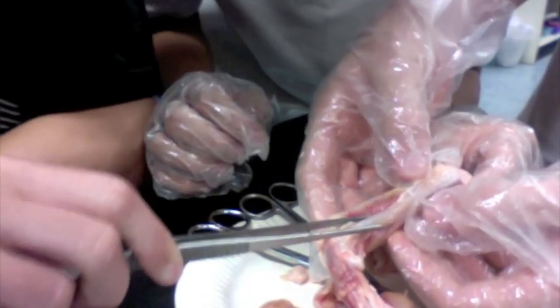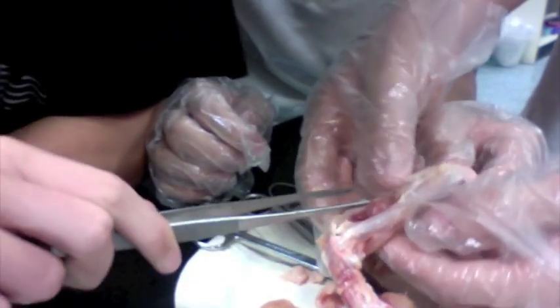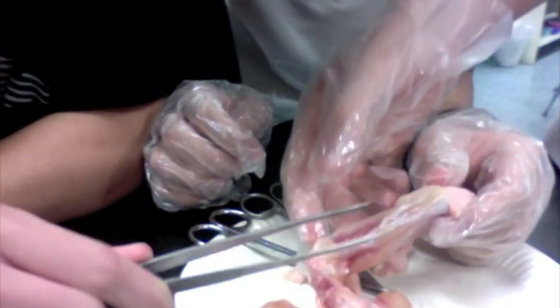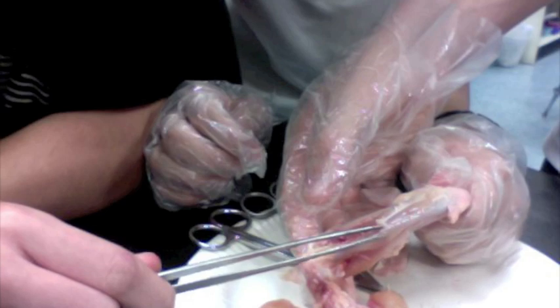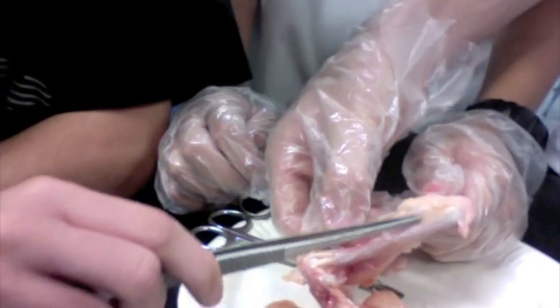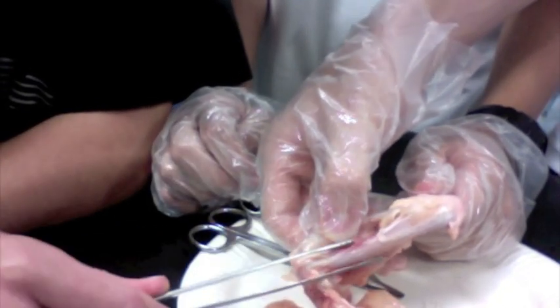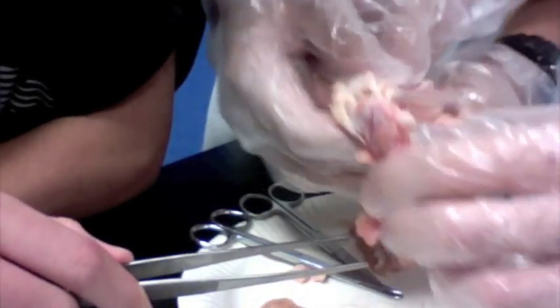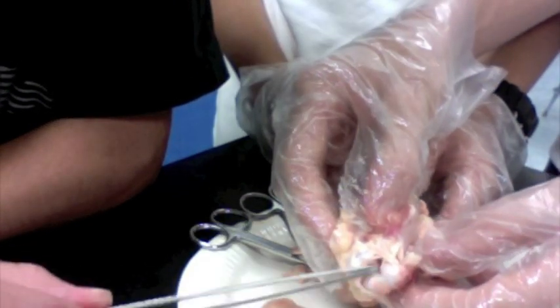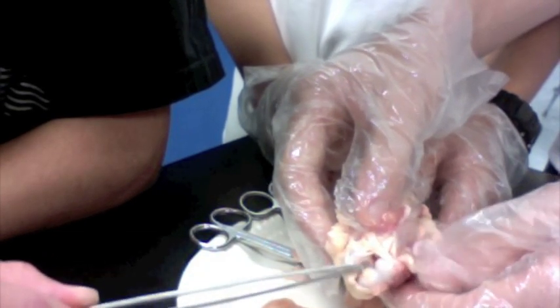The bones are basically just the structural system of the body, or the chicken — keeping the chicken's shape. The tendons attach the muscle to the bone so that the muscle can move the bone. The ligaments attach the bone to the bone so that it stays all together. And we got a bit of cartilage that cushions and stops the joint from rubbing.